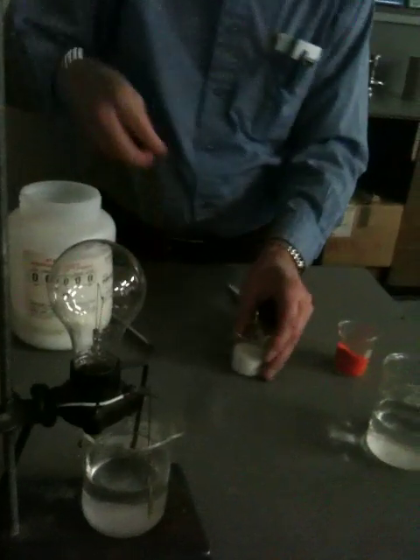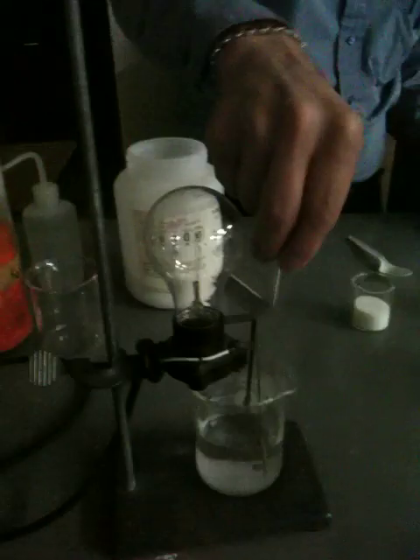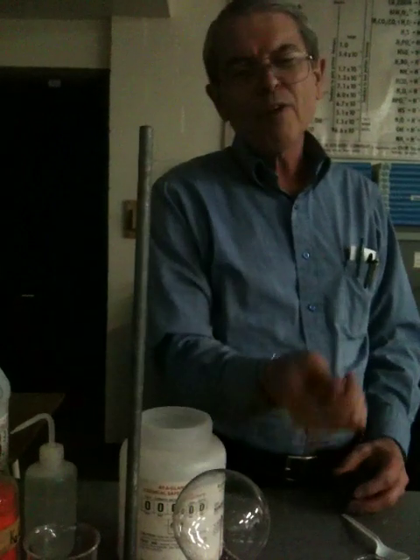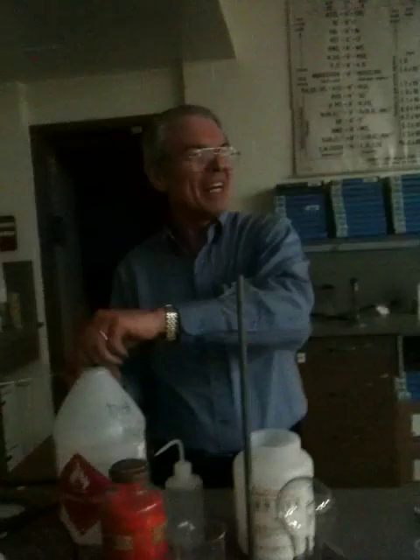Let's see. Put a lot of that stuff in — stir it up. Your predictions are right. No light. If you spit, if you have ions in your spit — and you do, your spit is salty — it will conduct electricity. You'd have to put a fair amount in there to get a light bulb going. I think we'll forego that experiment right now.